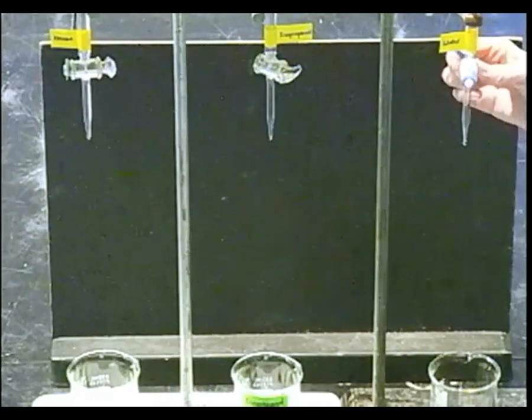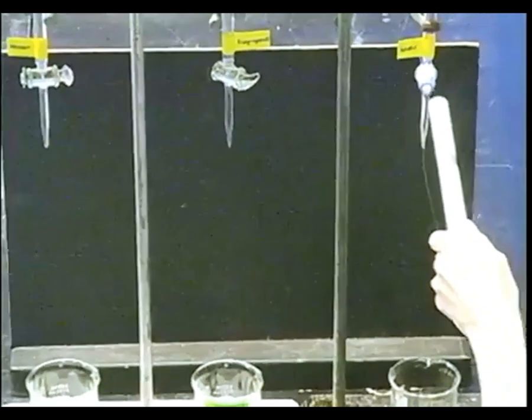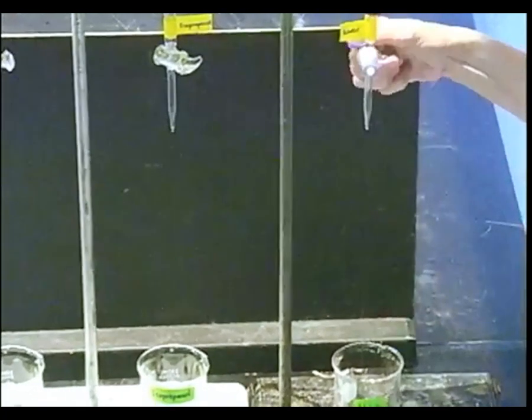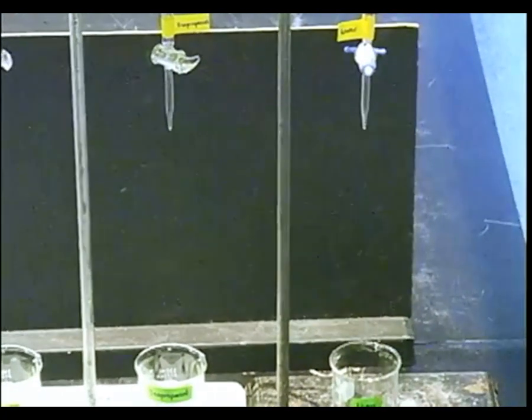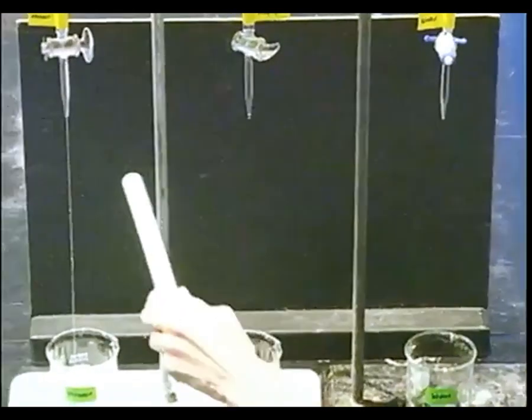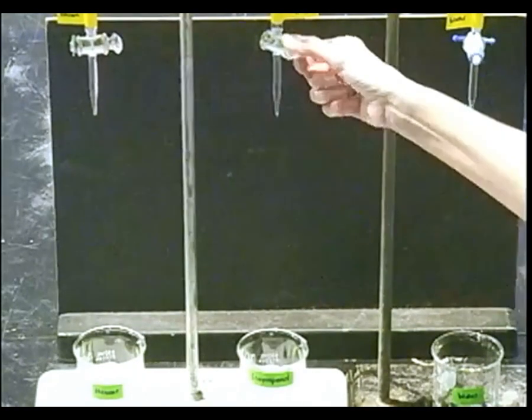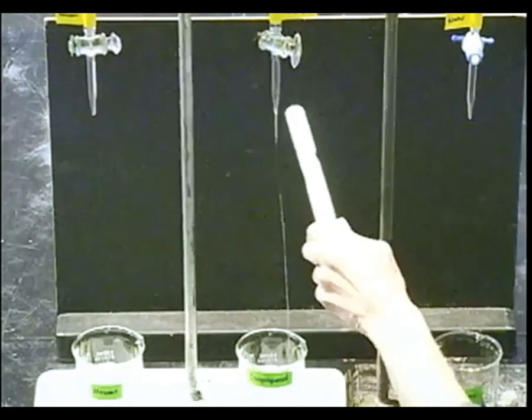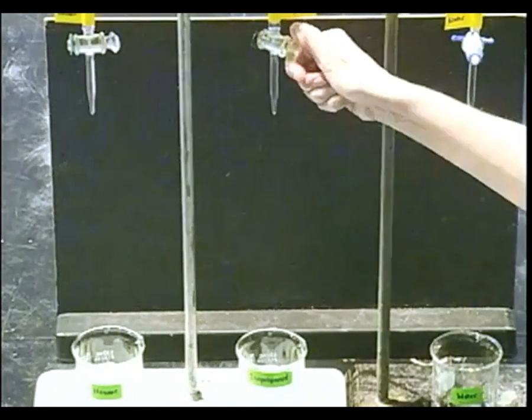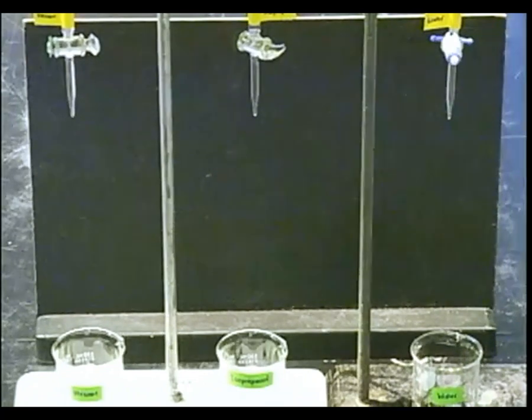We're going to start with water. What do you see with the water? Is water attracted to the wand? Let's try hexane next. Here's isopropanol — it also is attracted to the charged wand. It's not called a magic wand, but it tends to do amazing things with these molecules.